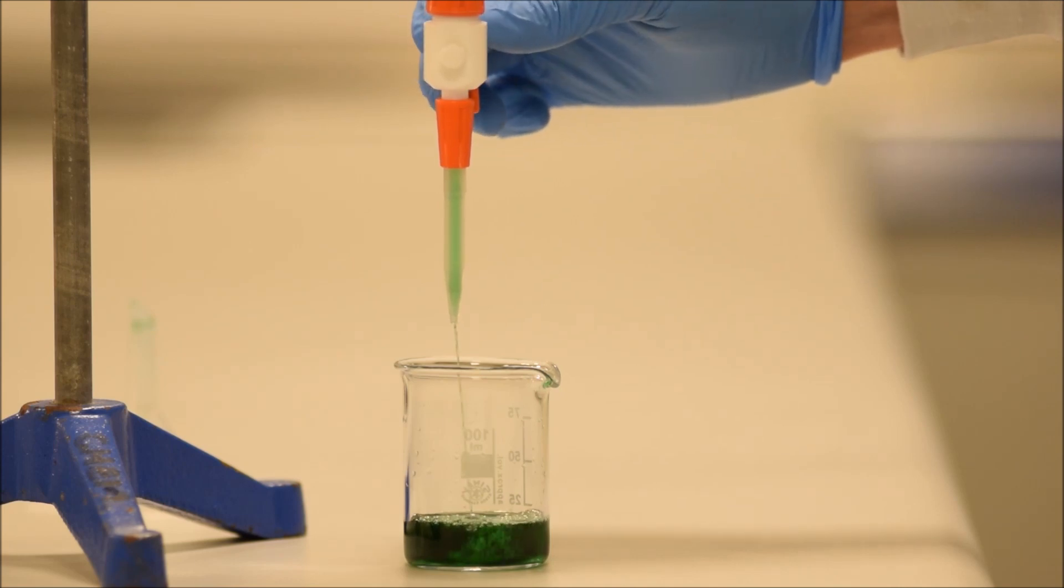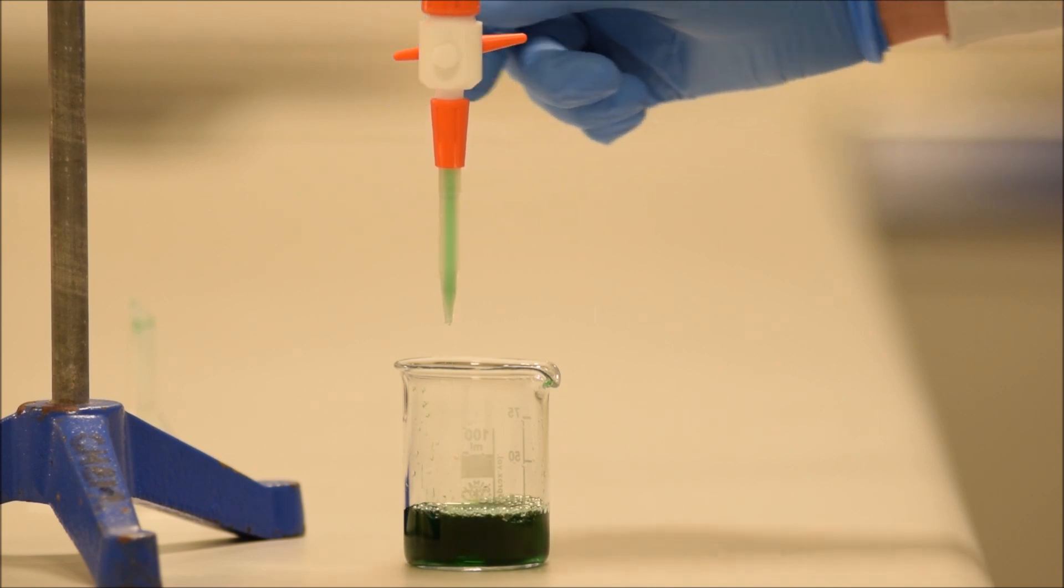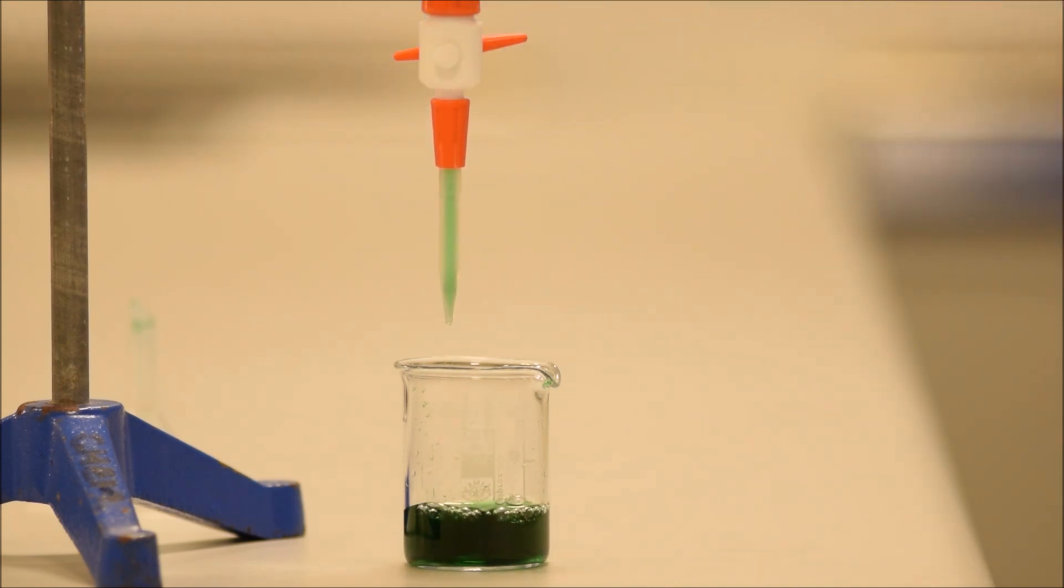And then let it run through, and you can see, even after a bit of a while, I can flick it, and there's still a few more to dislodge. So don't be shy about running lots of liquid through it before you start using it.